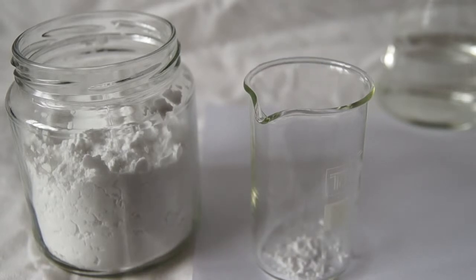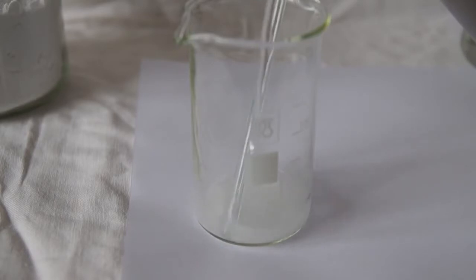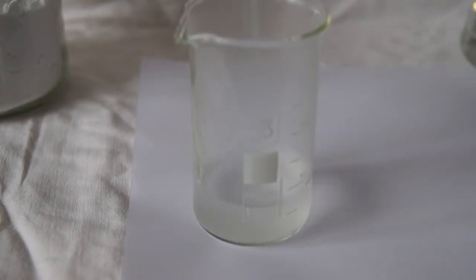Take a second beaker and dissolve there a little soluble potato starch. Dissolve starch in cold water, then pour boiling water into the beaker to better dissolve the starch. The solution becomes slightly cloudy.